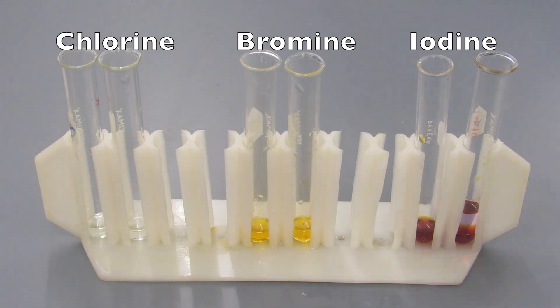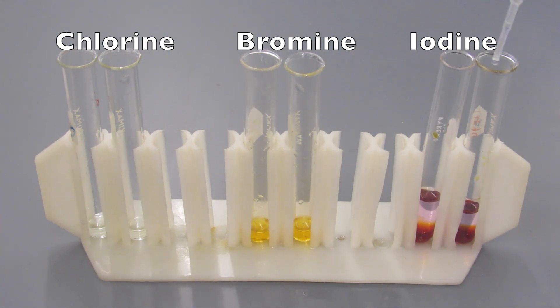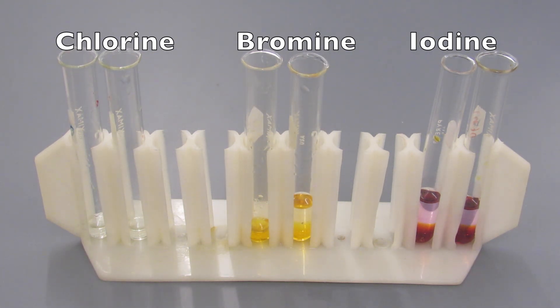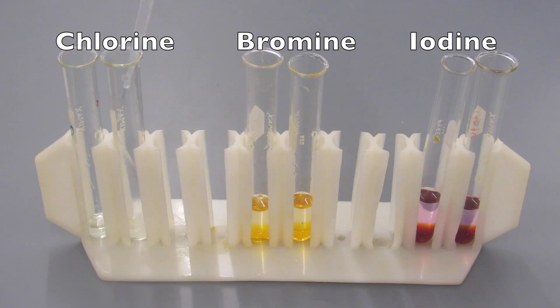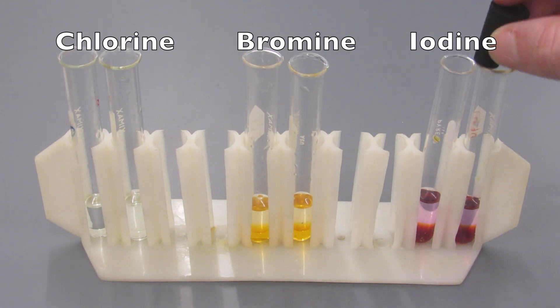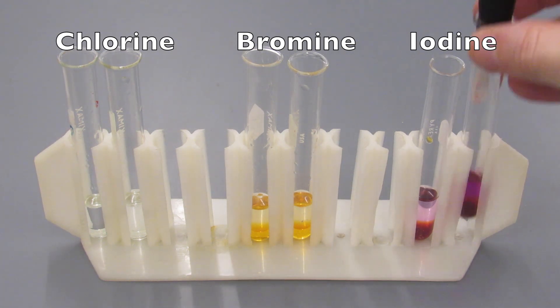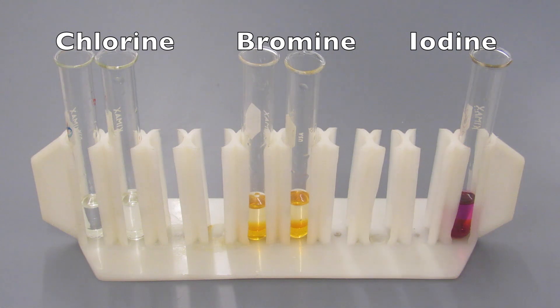Here we added a little bit of cyclohexane to the top of each halogen. By doing this, it allows the halogen, which is a nonpolar molecule, to get dissolved in the upper layer of the cyclohexane.